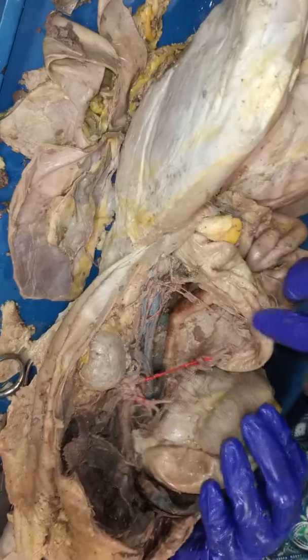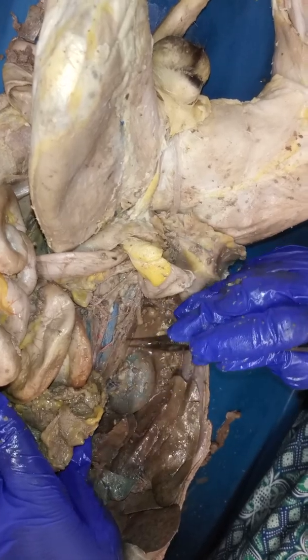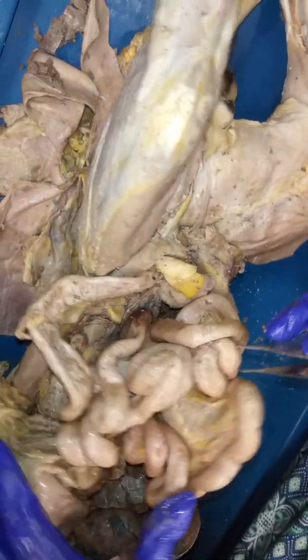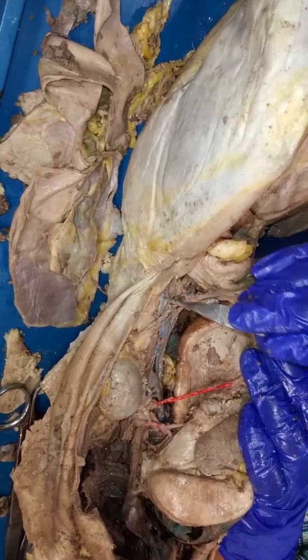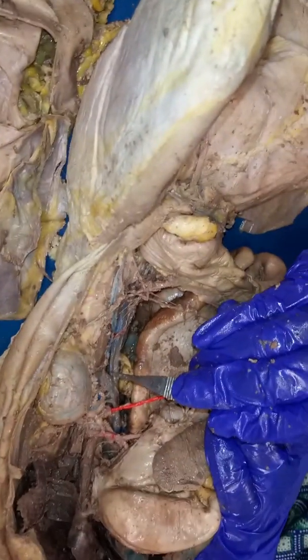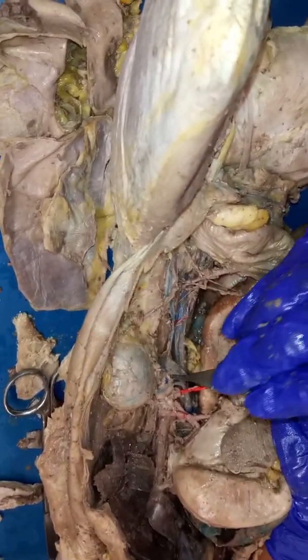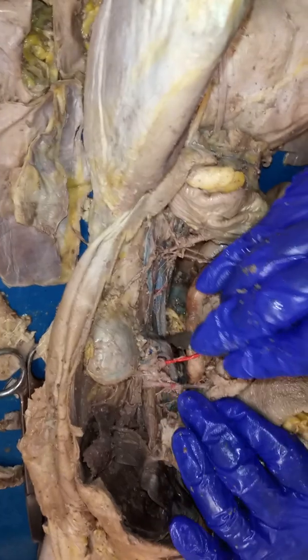On this side, you'll notice that there's this little branch point that's there. Whereas, okay, I'm going to come back to it, so don't worry. On this other side, notice that there isn't a branch point coming this way. Okay? That branch is actually the gonadal vein on the left side. So if you notice this really skinny vein coming up, it's going to drain blood. This is going to be coming from the testes, and then this is going to be the left gonadal vein. You don't see this kind of arrangement draining into the renal vein on the right side, just kind of an FYI, okay? And that's also true in the human as well. So you have your left gonadal vein that's here. Okay, here is your renal vein.